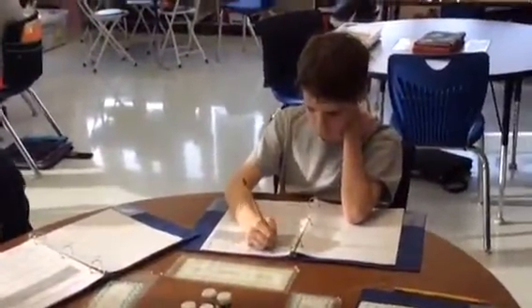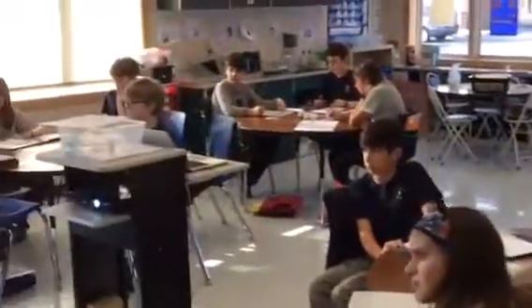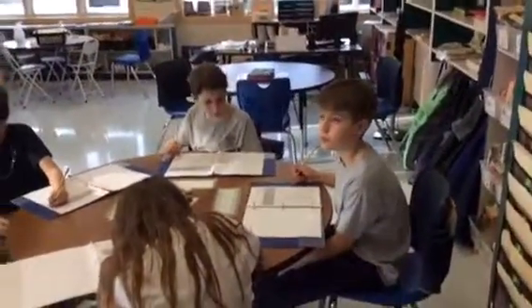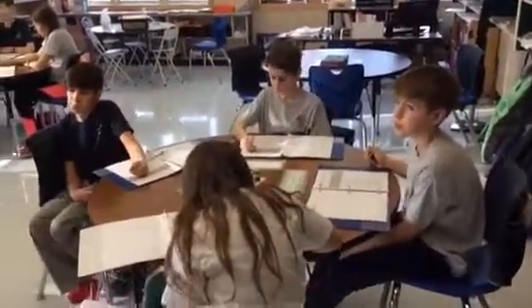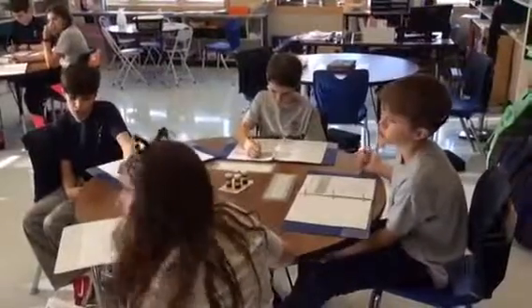So neighborhood B is now what? Acidic or basic? Okay. So 6 was slightly acidic. Now it's what? Acidic. Like way acidic, right? Lemonade. 6. So it went from a 7 to a 6. What kind of change happened there? It went from neutral down to slightly acidic.